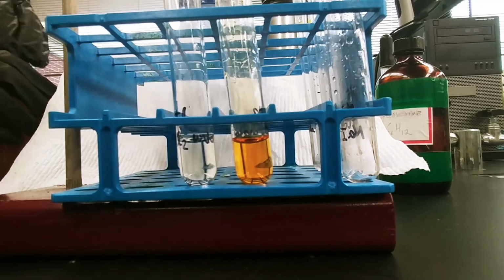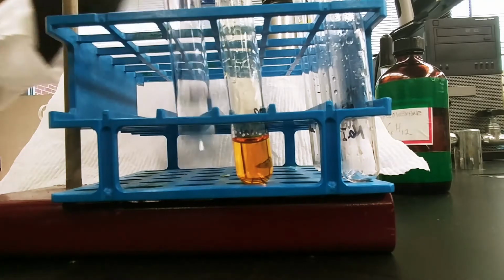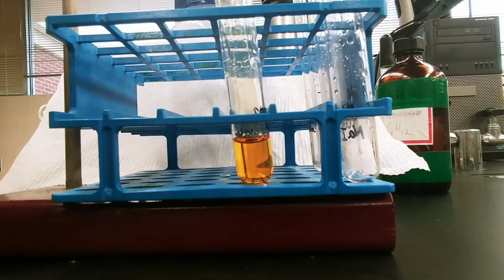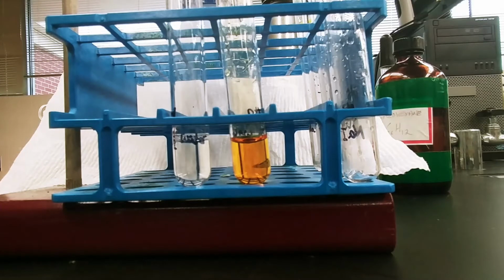And this will be what activates the development of chlorine in water. One of the ways we know that this is working is that there's a distinct pool smell, right? The chlorine that they use to sterilize pools.